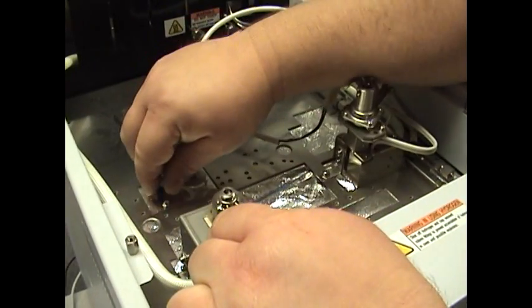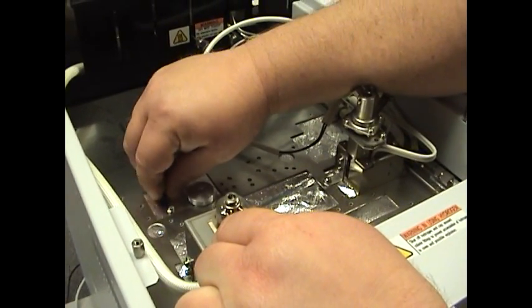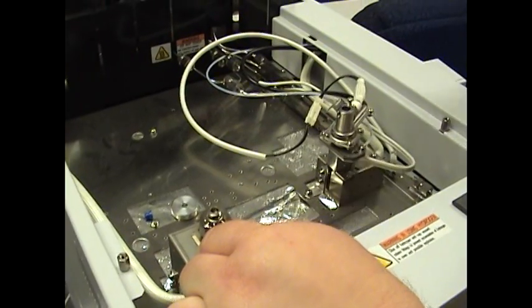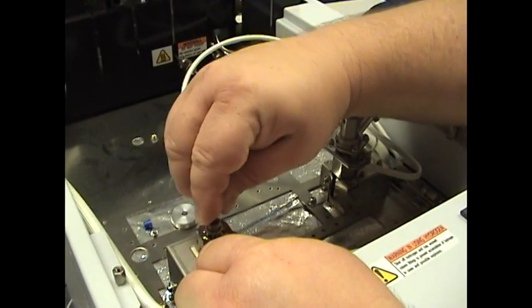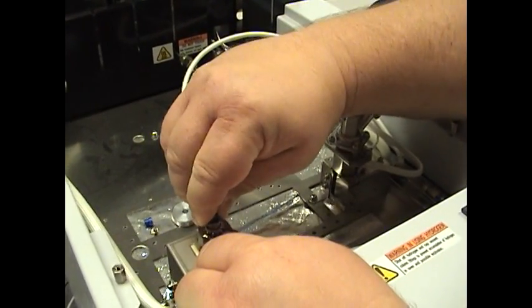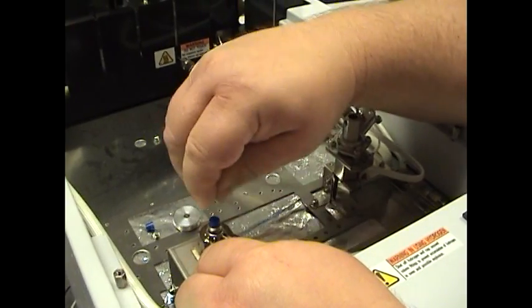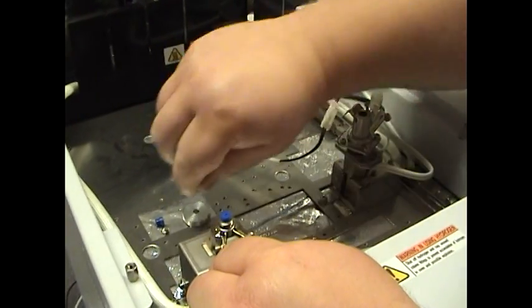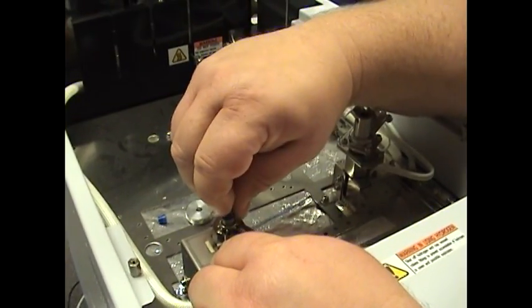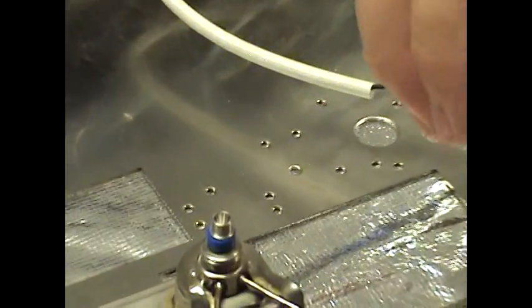Alright, to change the SEPTA out, get a new SEPTA. Place it in the hole. Make sure it's seated firmly.